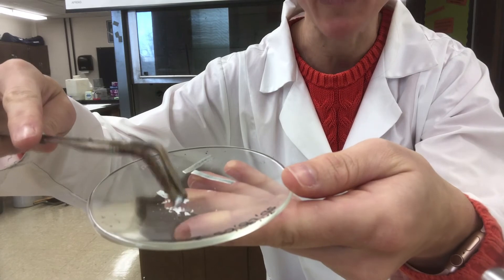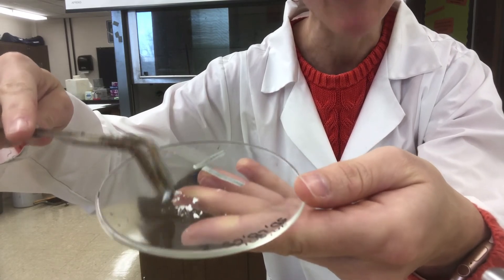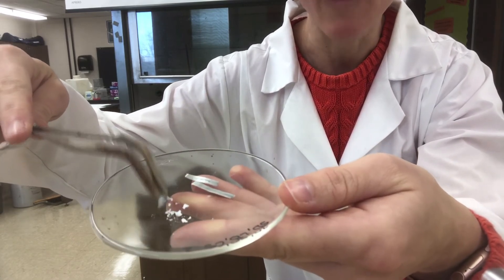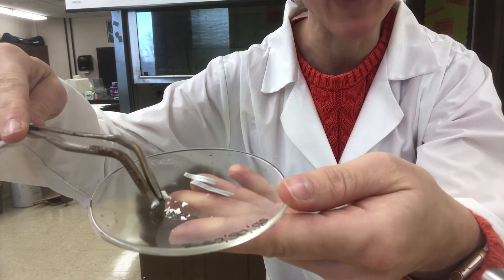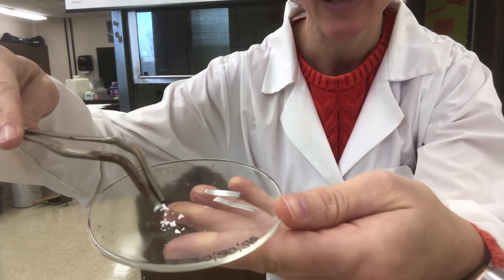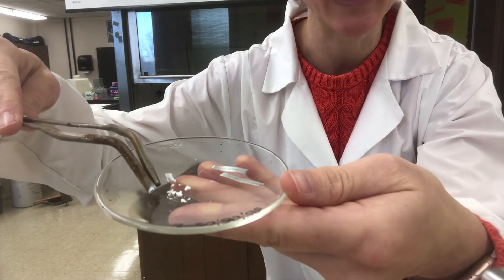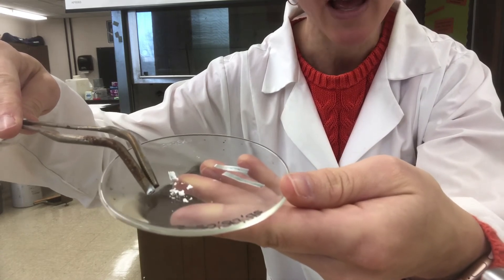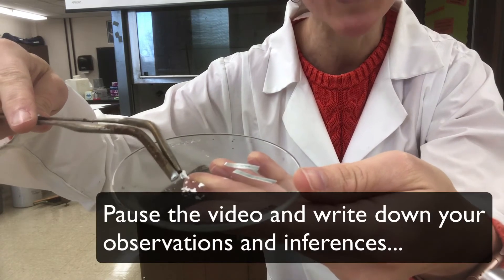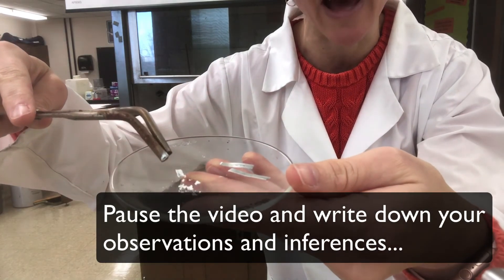It's a white crunchy powder, and that's the product of the burning of the magnesium ribbon. So this is what we started with — the magnesium ribbon — and this is what happens after I burn it. Make your observations, and then make an inference: was this a chemical change or a physical change, and why do you think that?